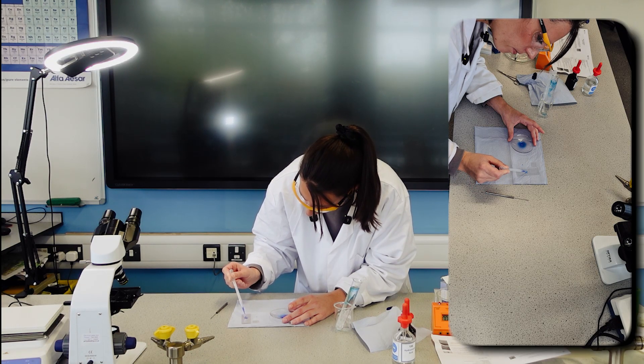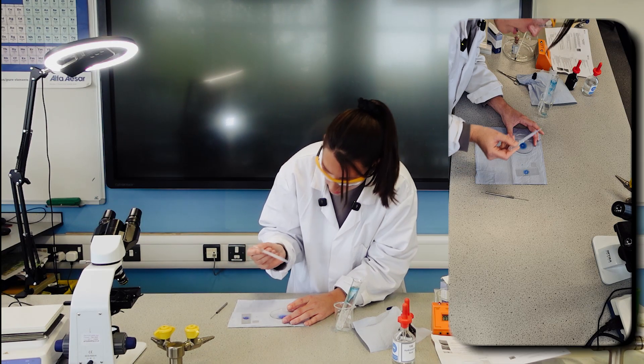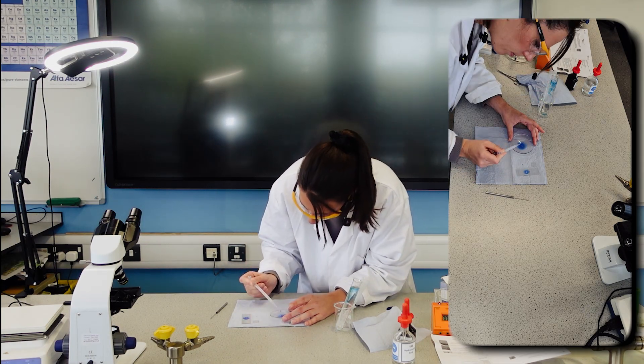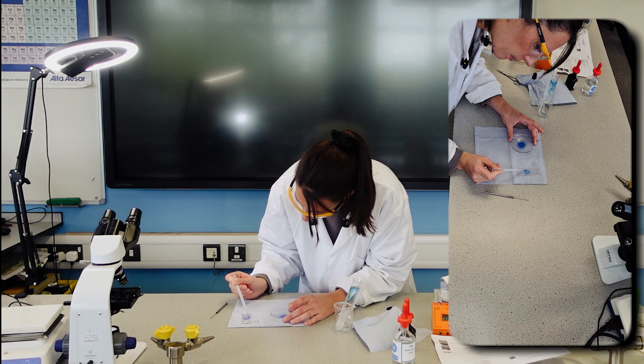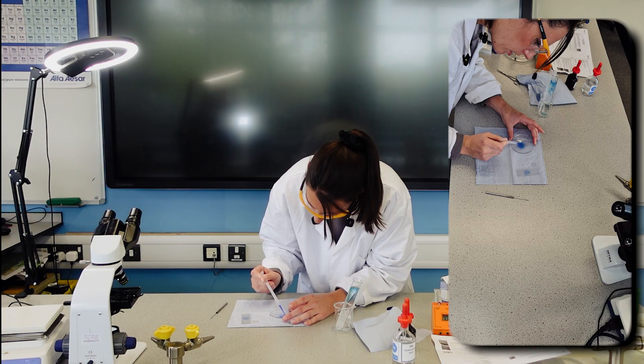So there's some of it there, some of that excess liquid. And there's some more root tip.